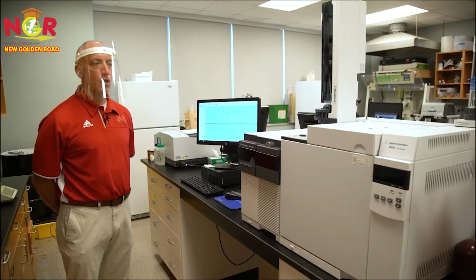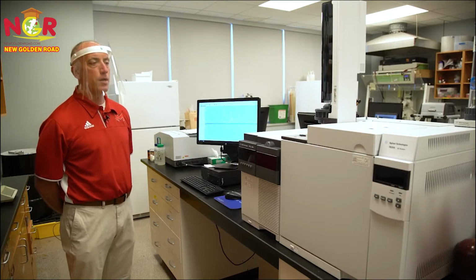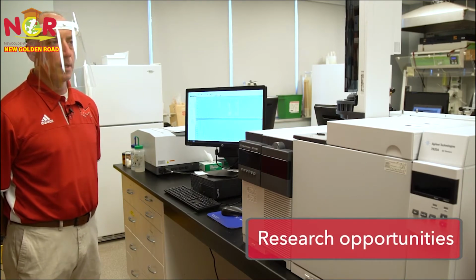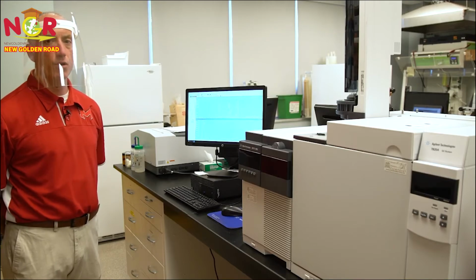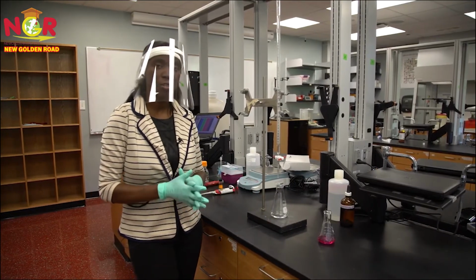This is our gas chromatograph mass spectrometer. You'll see an instrument like this typically in CSI or NCIS. You can use it to quantify or identify different compounds. And an example would be in quantitative analysis, we actually use it to quantify the amount of ethanol in a particular beverage.